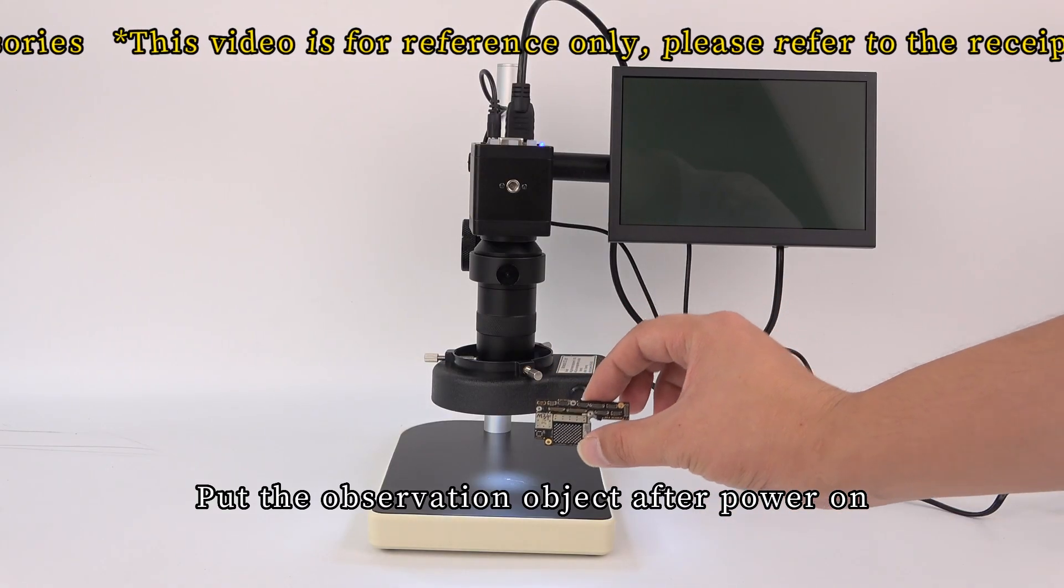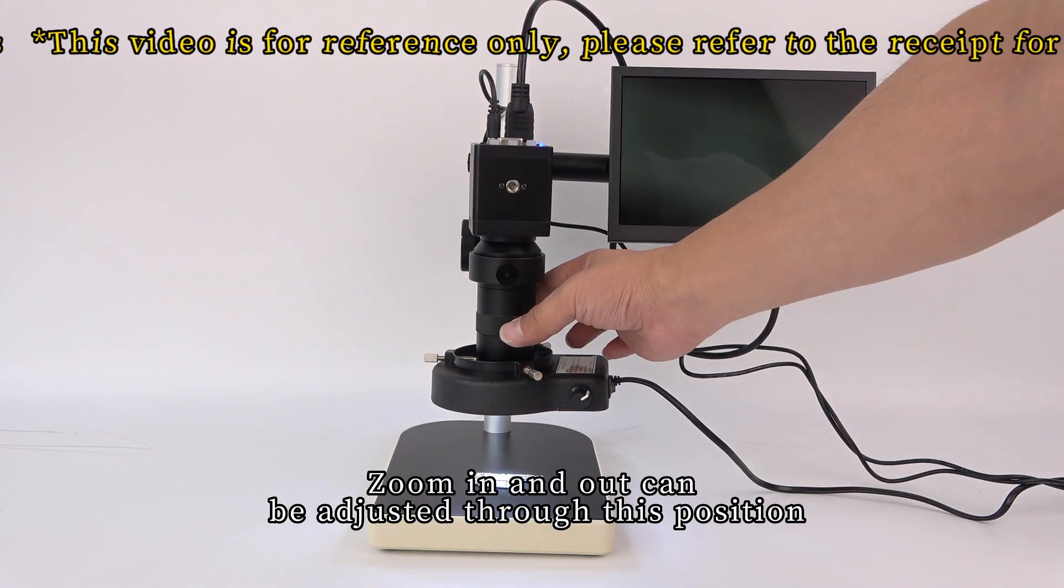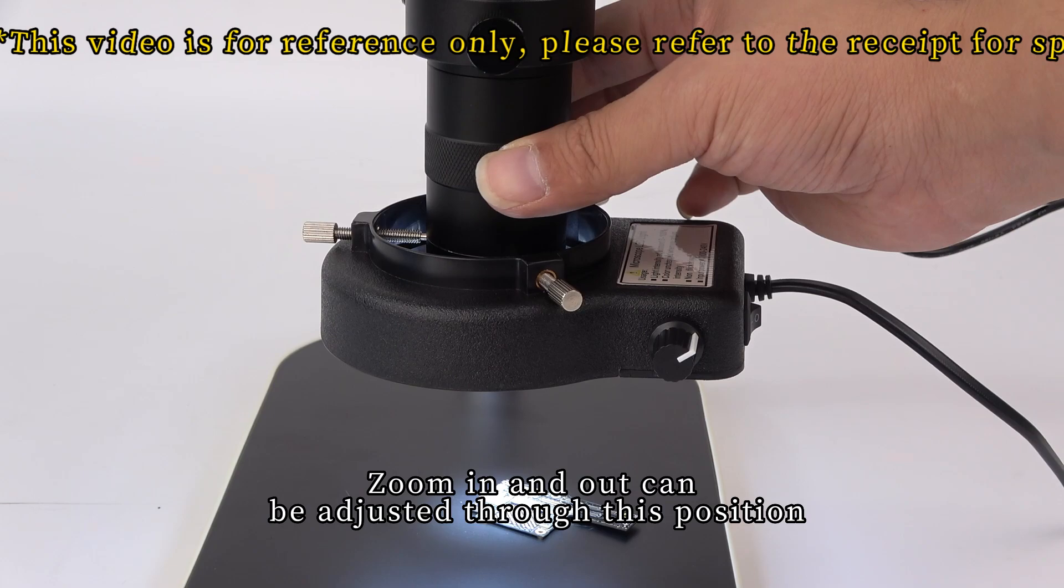Put the observation object after power on. Zoom in and out can be adjusted through this position.